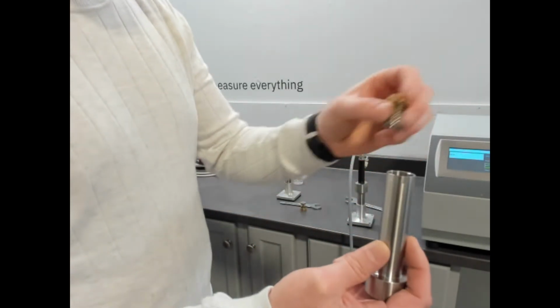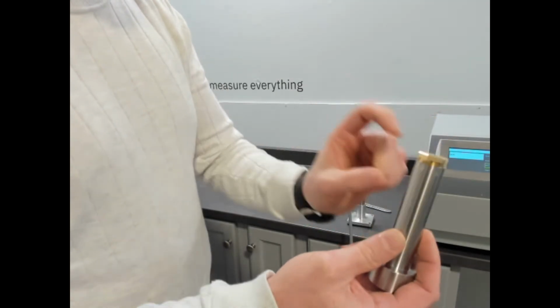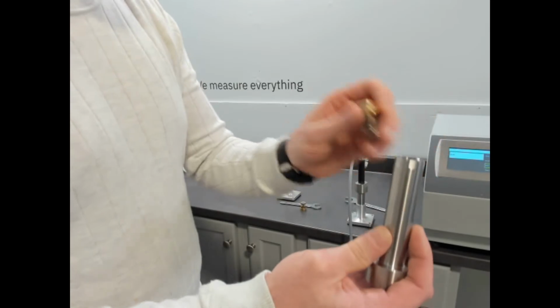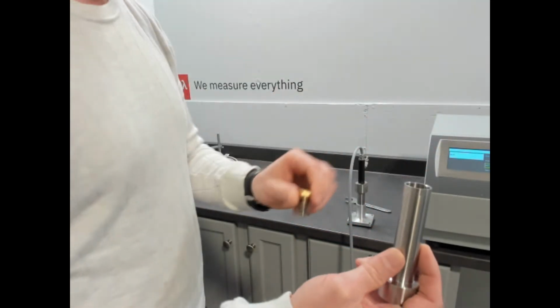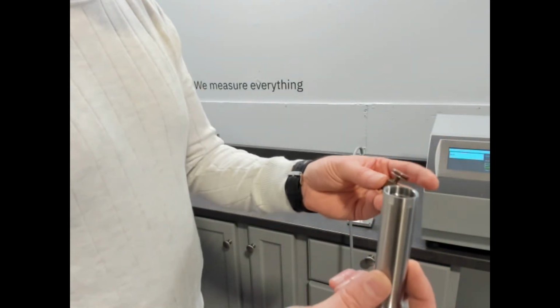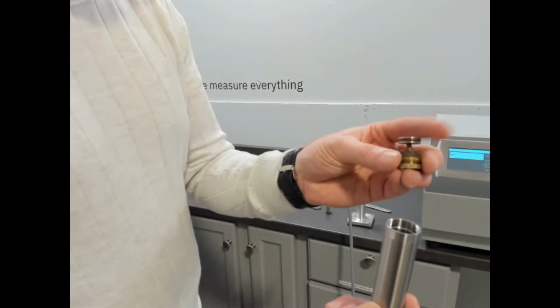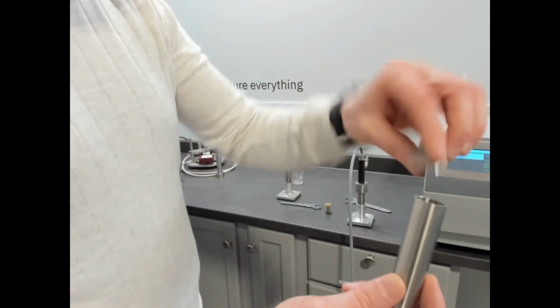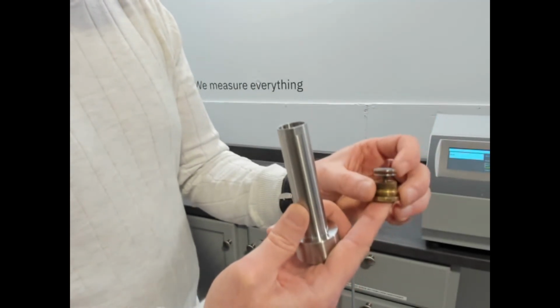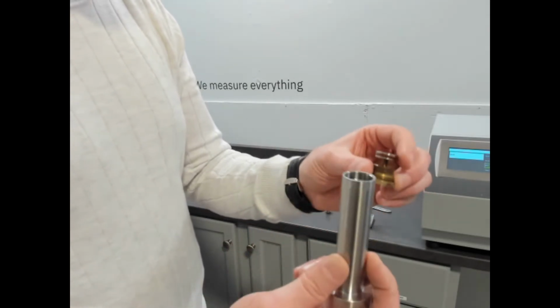That's really important. So you would fill this to a point and then screw this on, and that would allow you to apply a little bit of mechanical pressure so that the phase change material stays in contact with the wire. That's really important. The other version of that, same cell, just different approach. If you want to measure powders or materials that you want to set the volume, this is an adjustable variable density fit, and there's an Allen key, hex key, and then you would just turn this up or down depending on how much pressure you want to apply, and that goes up and down about 15% as well.